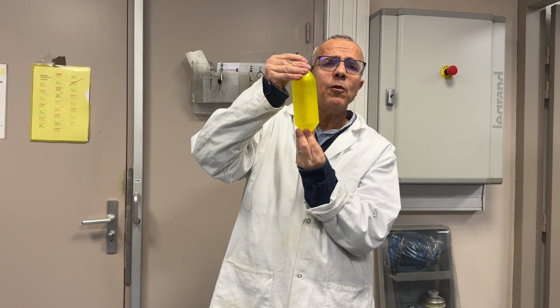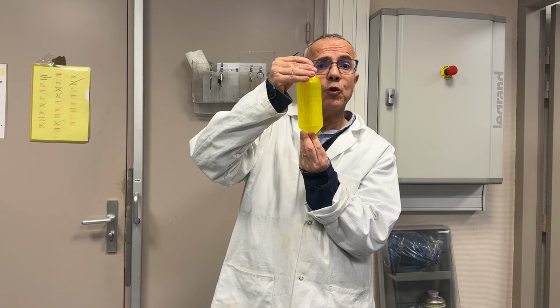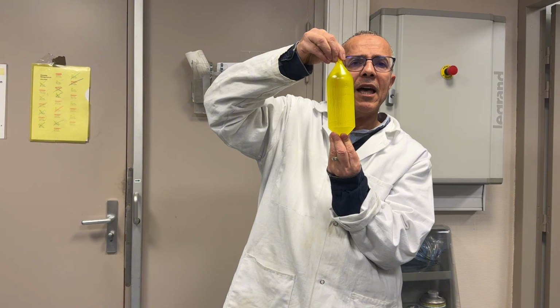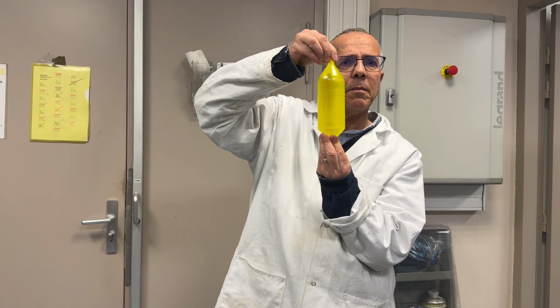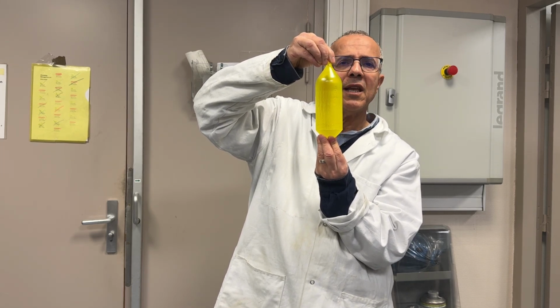To grow this crystal, it takes about 2 weeks, including the heating step, the growth process, and the cooling step. To get a good decay time and good scintillation properties, this crystal is co-doped with cerium and magnesium. The weight of the crystal is about 2.7 kilograms.